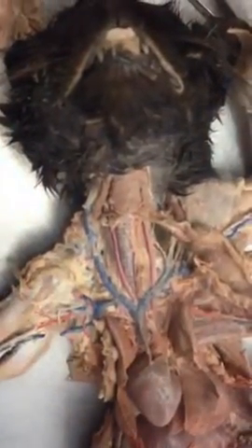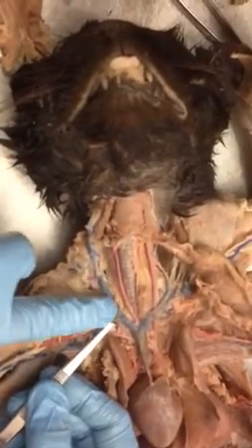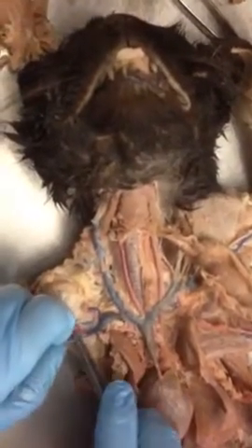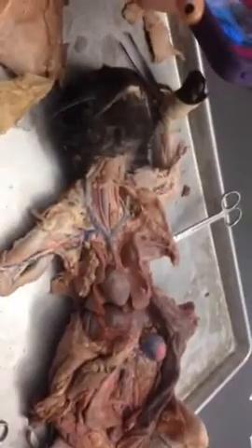Basically, you have to remember it's the veins coming back towards the heart. So the subclavian vein and the external jugular together form the brachiocephalic. So subclavian, and then axillary, and then brachial. They run along the same as the arteries. Now down here, we only really see renal vein, and then we get down in here and we see iliac.